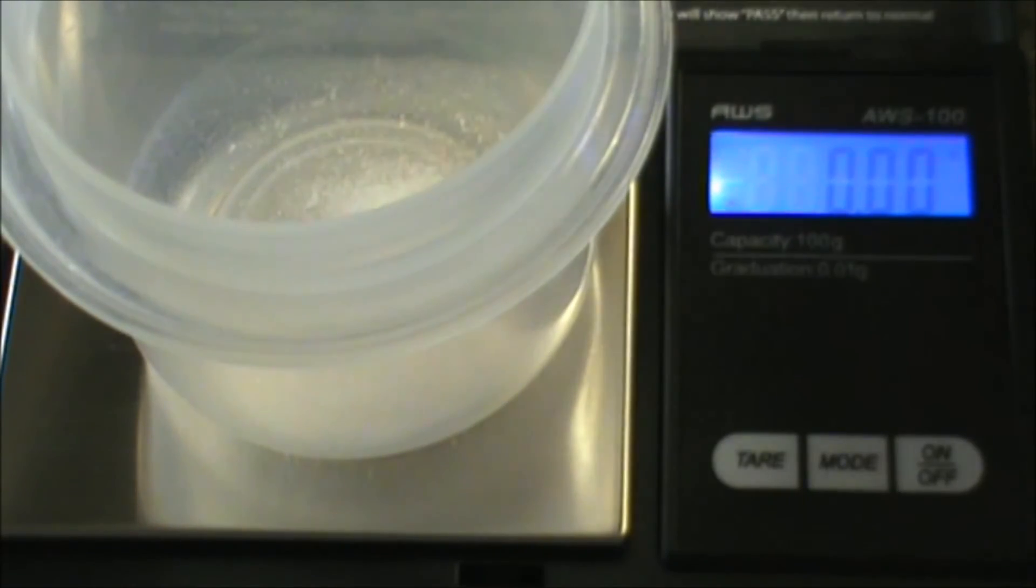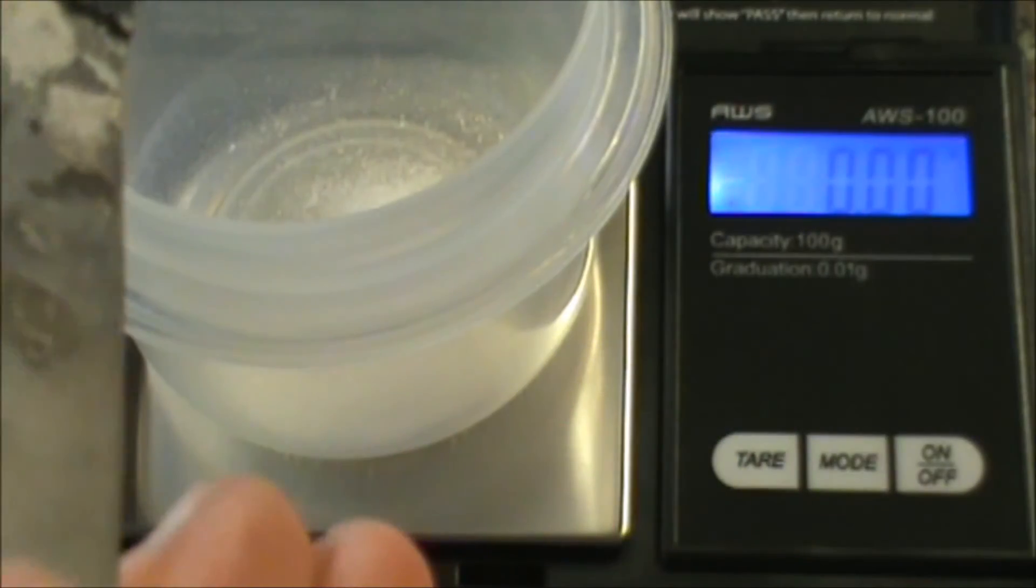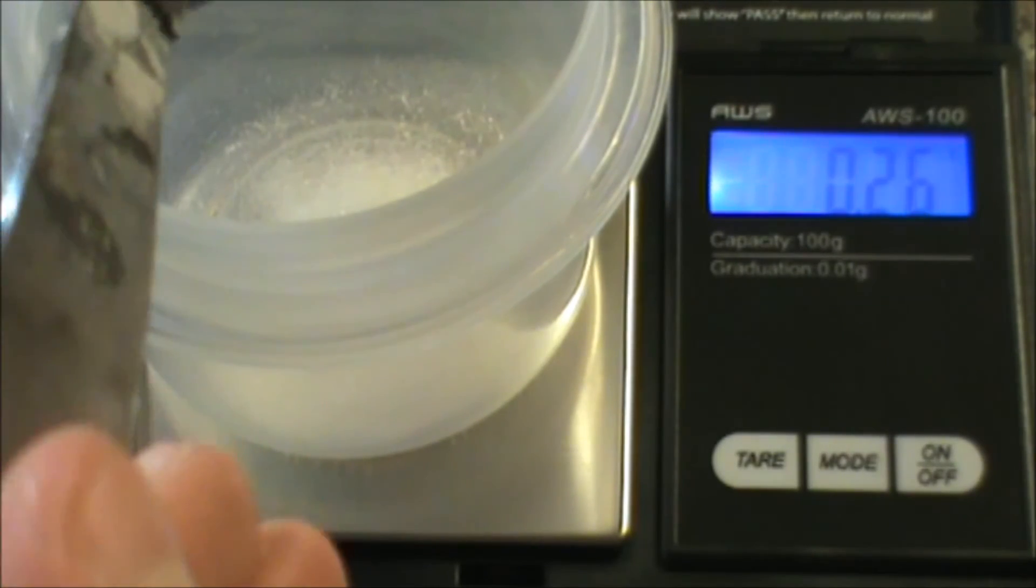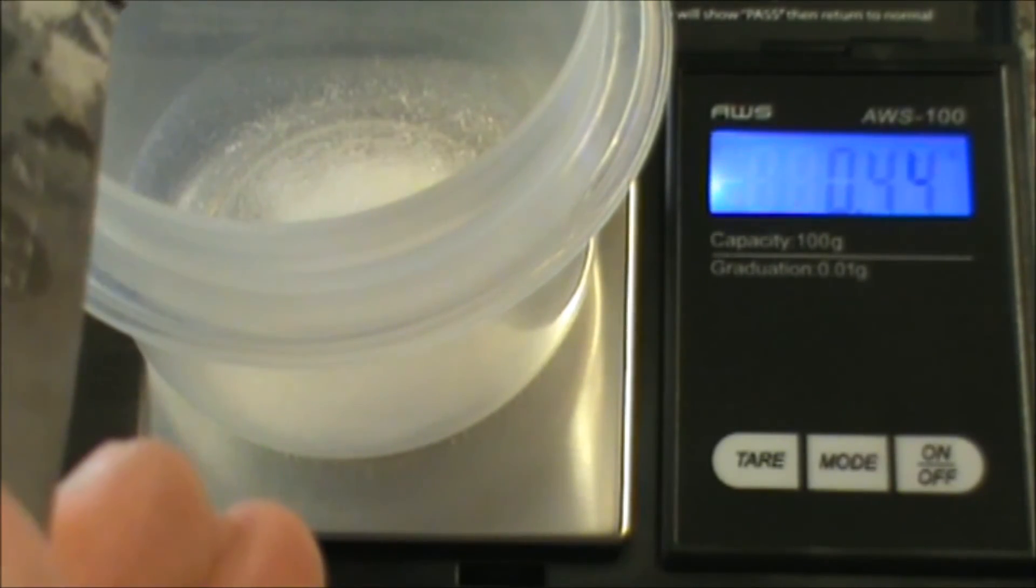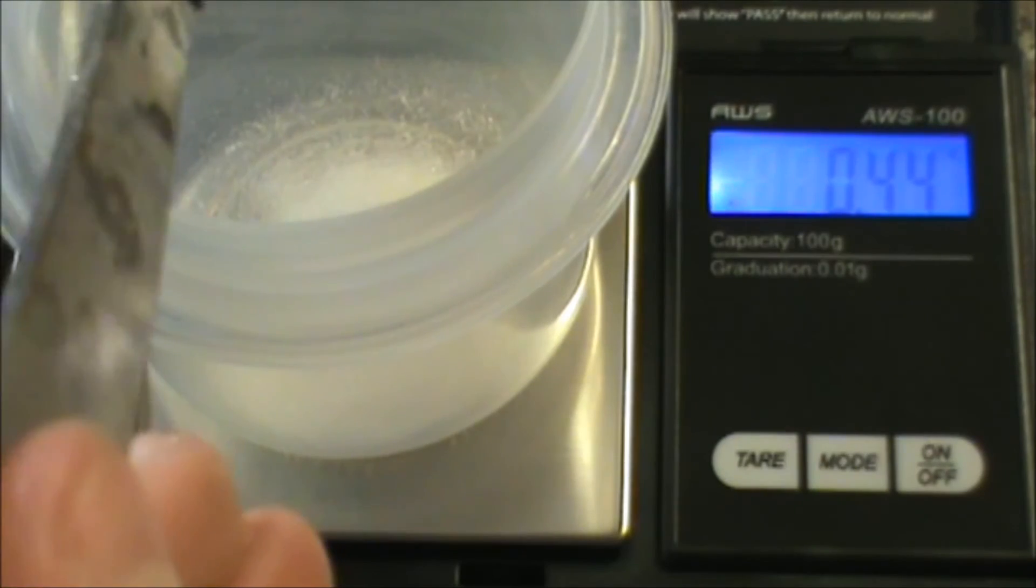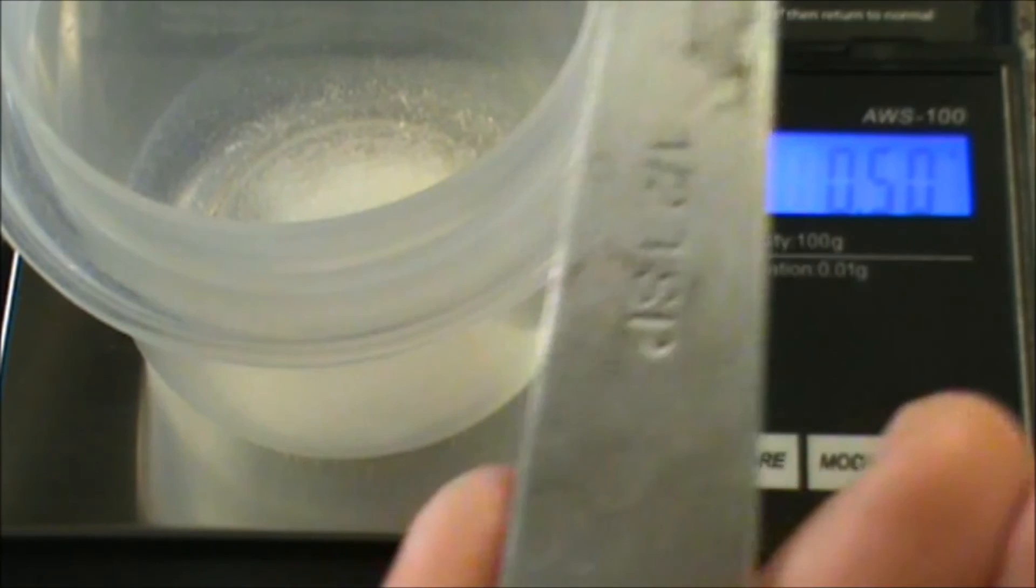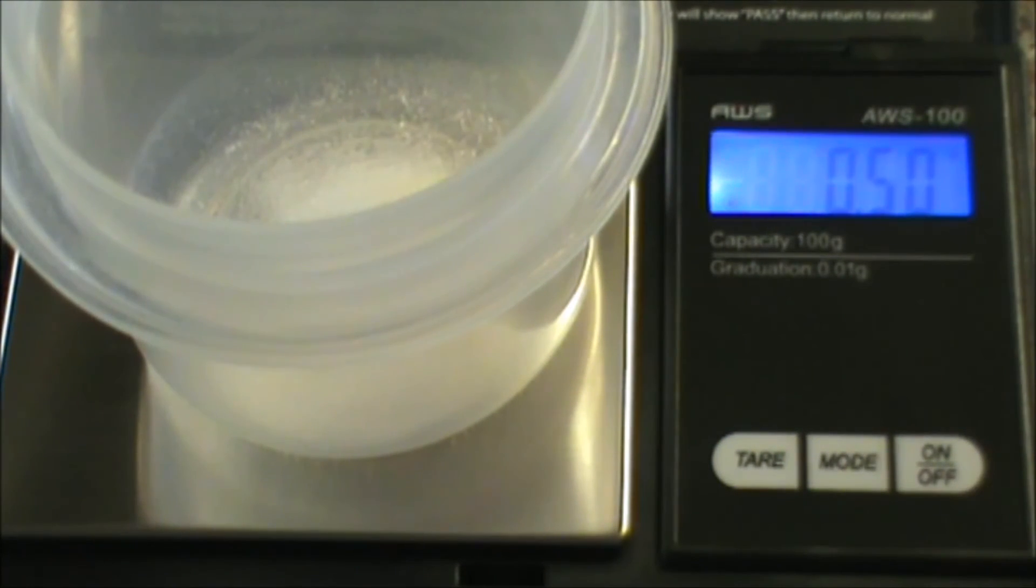So it's very easy to clean up. I'm going to aim for another 500. And there I go, I'm at another 500 milligrams, so in this container I now have one gram of vitamin C.